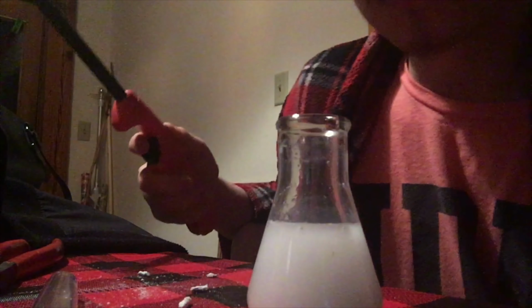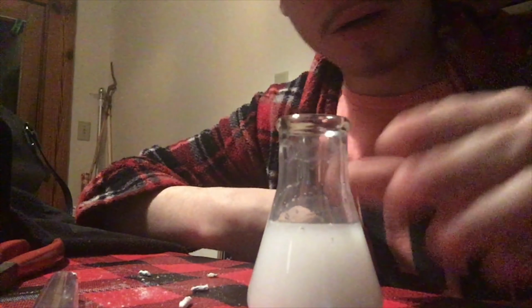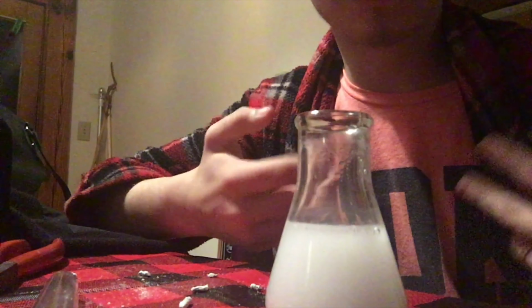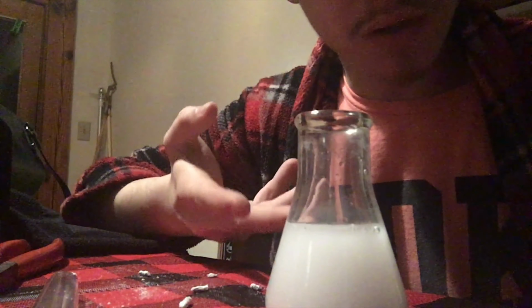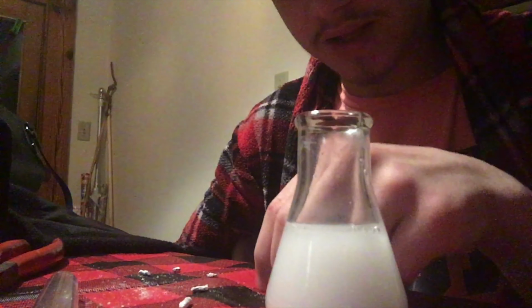So that's what calcium does, and we're creating a calcium hydroxide slush, which is also known as lime water. It's considered a calcium hydroxide solution, even though calcium hydroxide is insoluble. I don't know why it's called that. I don't recommend tasting it, and I'm not going to taste it. I do stupid things on this channel, but I'm not that stupid.